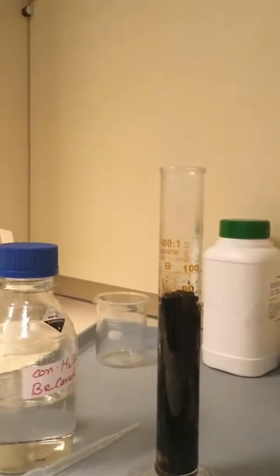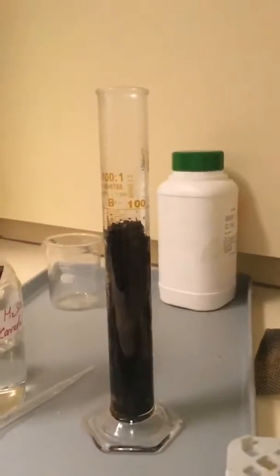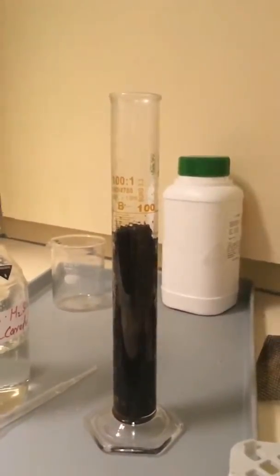Do you want to look? Look, it's going to do the turd of chemistry. Come see, come see, come see. Look, it's going to go out the top. It might get to the top. Oh no, oh it smells. That's why I left you with that.